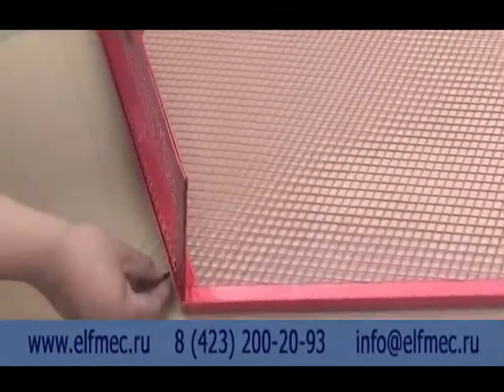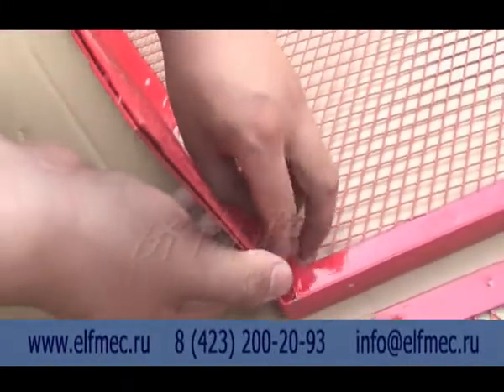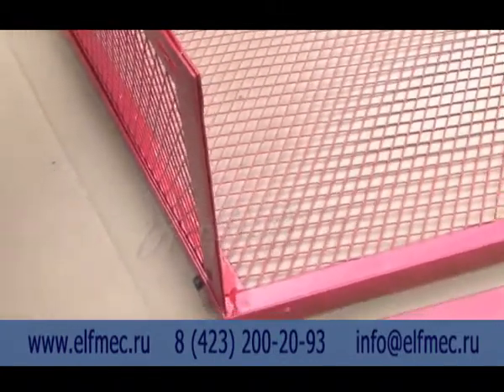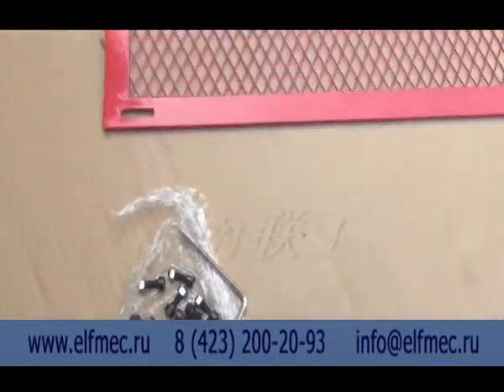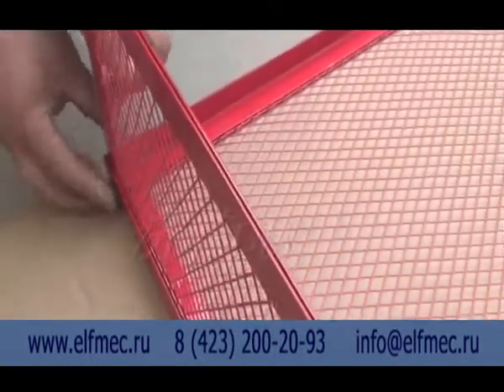Put the net parts together according to the video installation assembly sequence. After completion of the assembly, connect it with the impact host to ensure the normal operation of the equipment, not obstructing and protecting the operator.